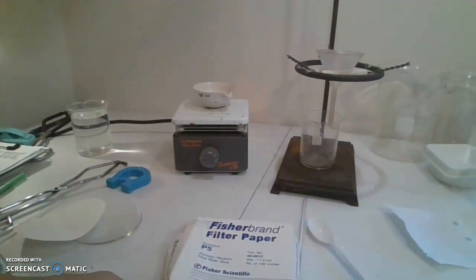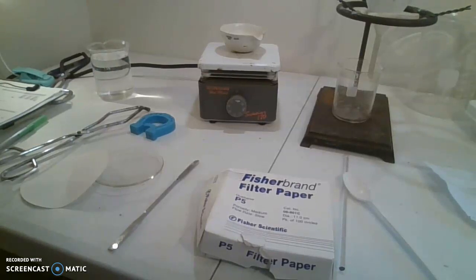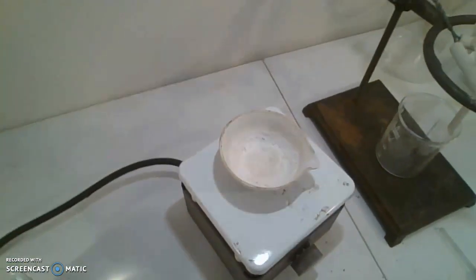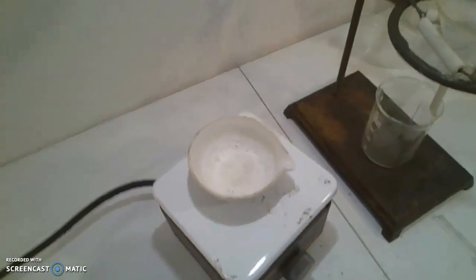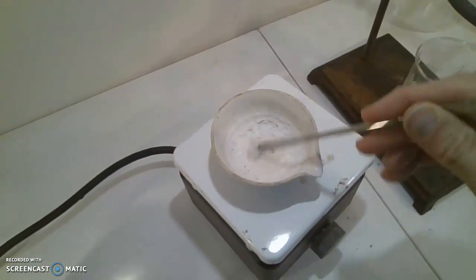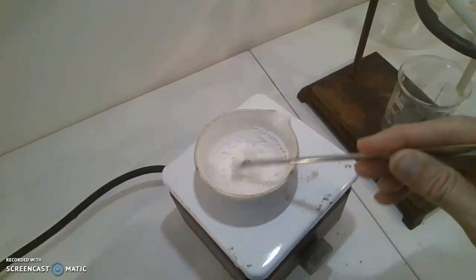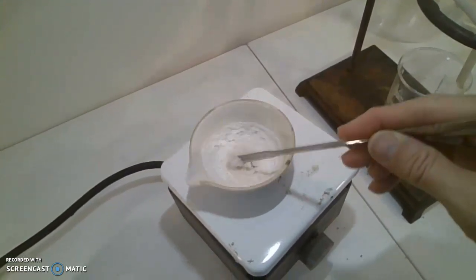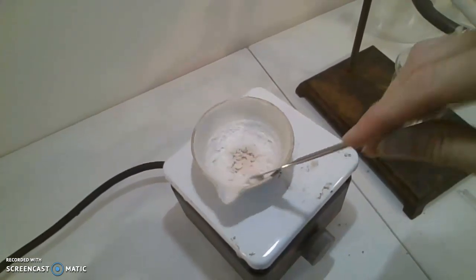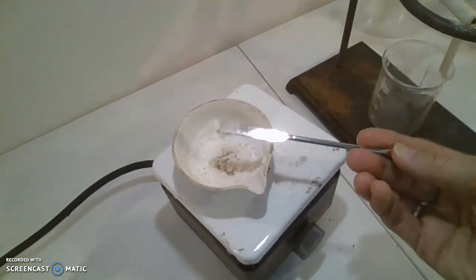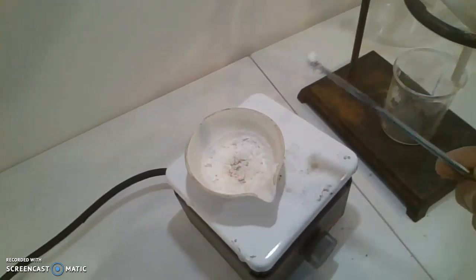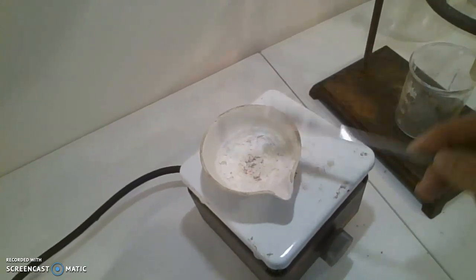After a time-lapse to 20 minutes, what you see here is all the water has evaporated and it leaves the salt behind. If you take a look, I can scrape a little bit off. You can see how the salt collects, leaving the opposite of solubility. This is extracting and evaporating the solvent and having salt remaining, so we have a separated mixture.